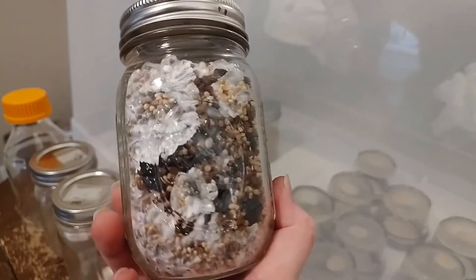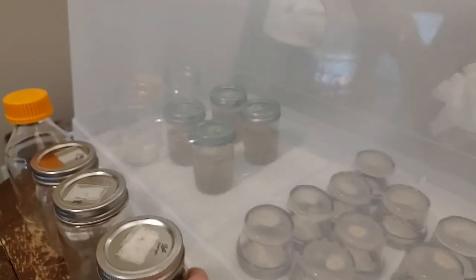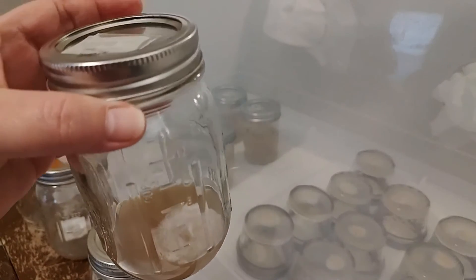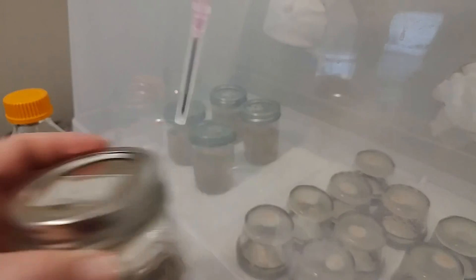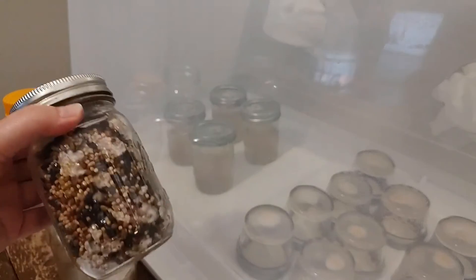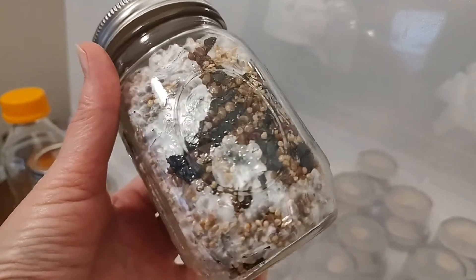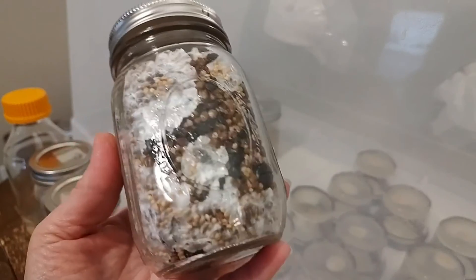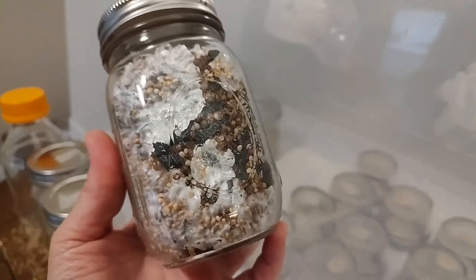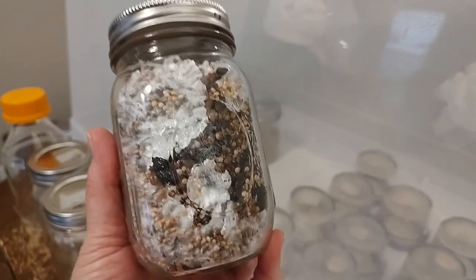It's really easy to move out of spores into mycelium. When you're ready to grow, you just pop your syringe in, pull out your liquid mycelium, put it right into your grain — your WBS — and you immediately start colonizing what you really want. When you're more advanced, you can start cloning your own mushrooms. Whatever mushrooms are your prized ones — maybe the tastiest or most beneficial — you clone those and replicate that to grow the very best of everything.